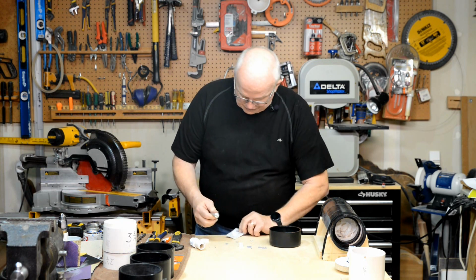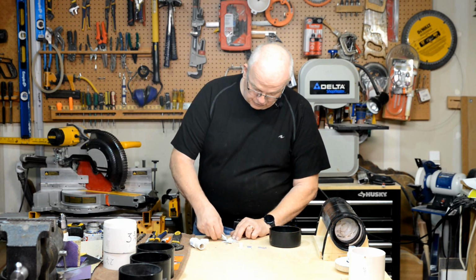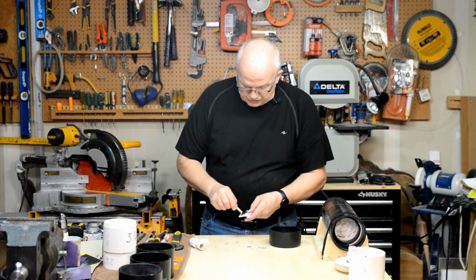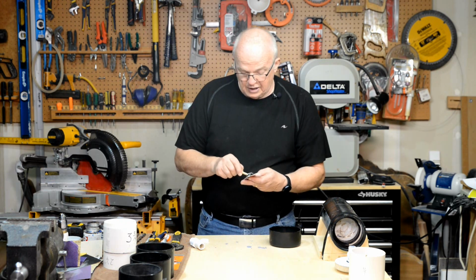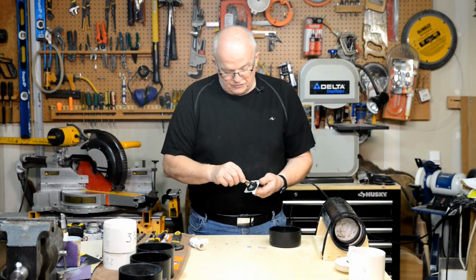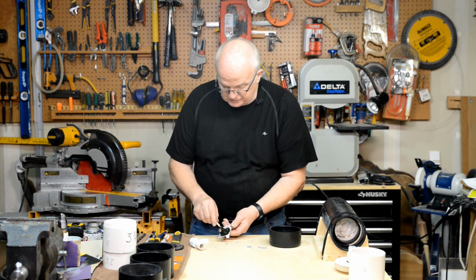So I am mixing up probably about a full teaspoon of each one. And we're going to start mixing this up. I'm going to do this for about a minute, maybe a minute and a half. And so I'll be right back. Okay, that's very well mixed. I've got quite a glob there.